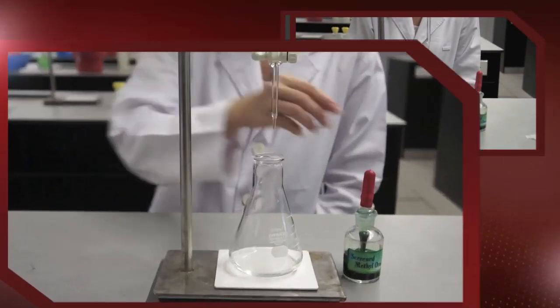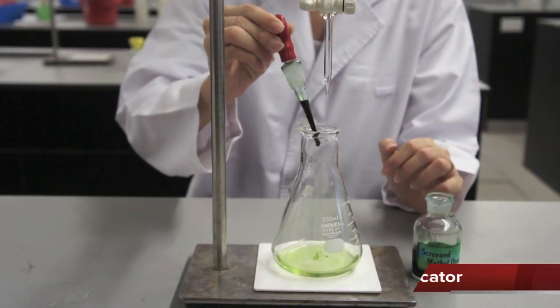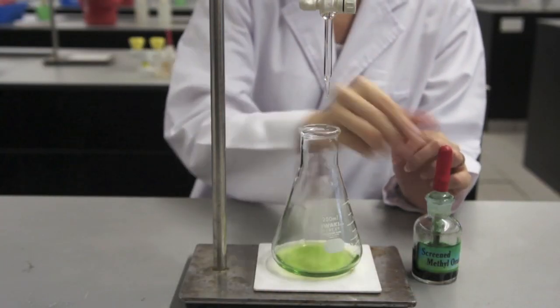It's time to start your titration. The first thing to do is to add the indicator. Add enough so that you can see the color, but not too much so that the solution is opaque.